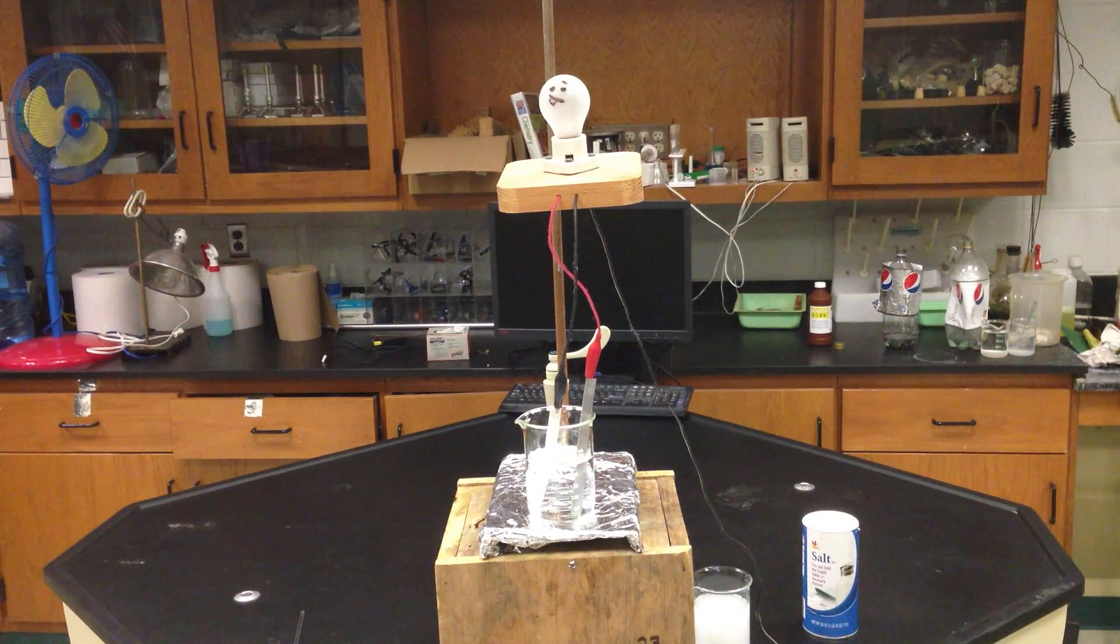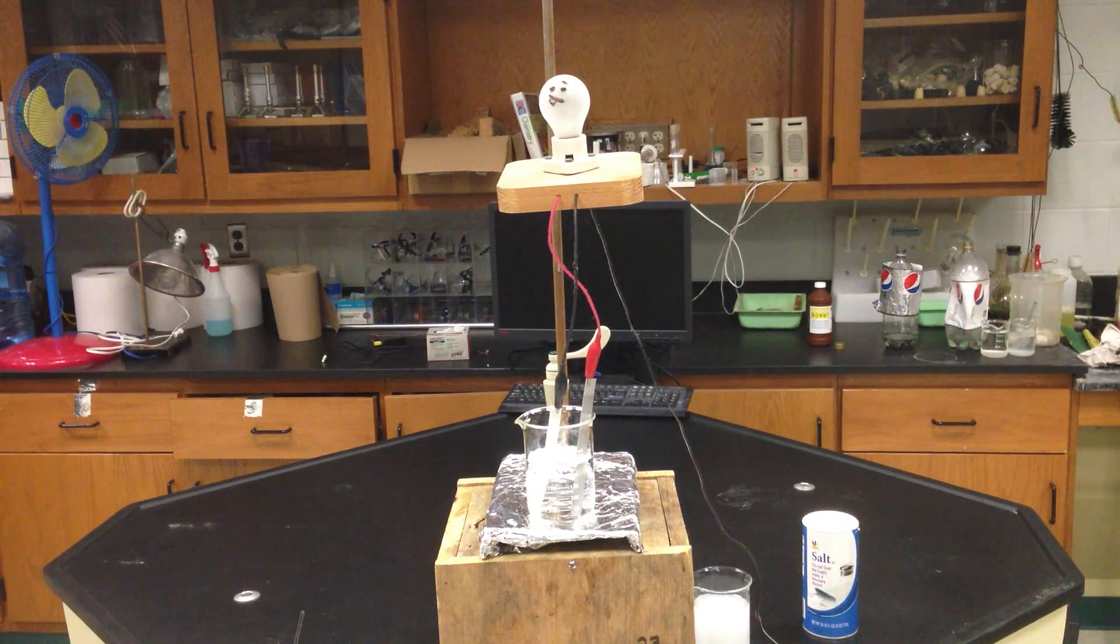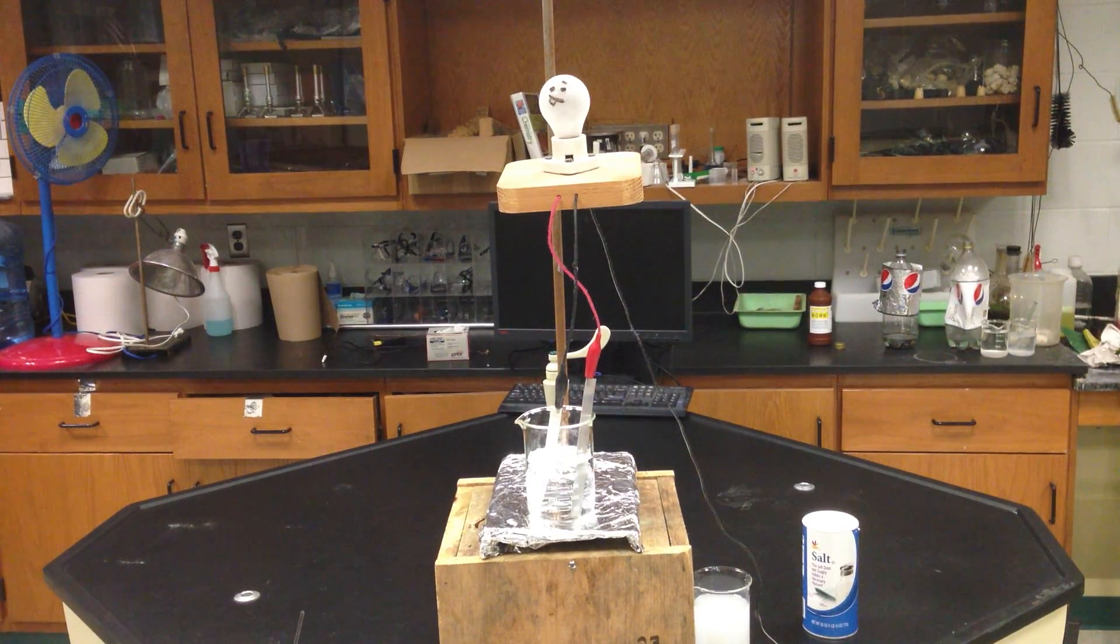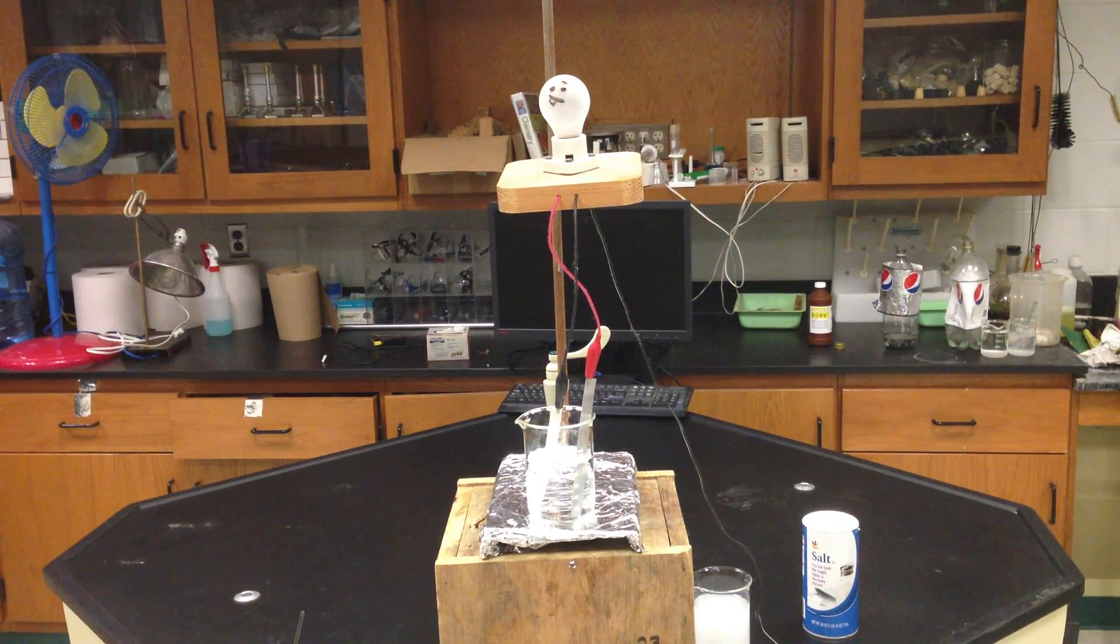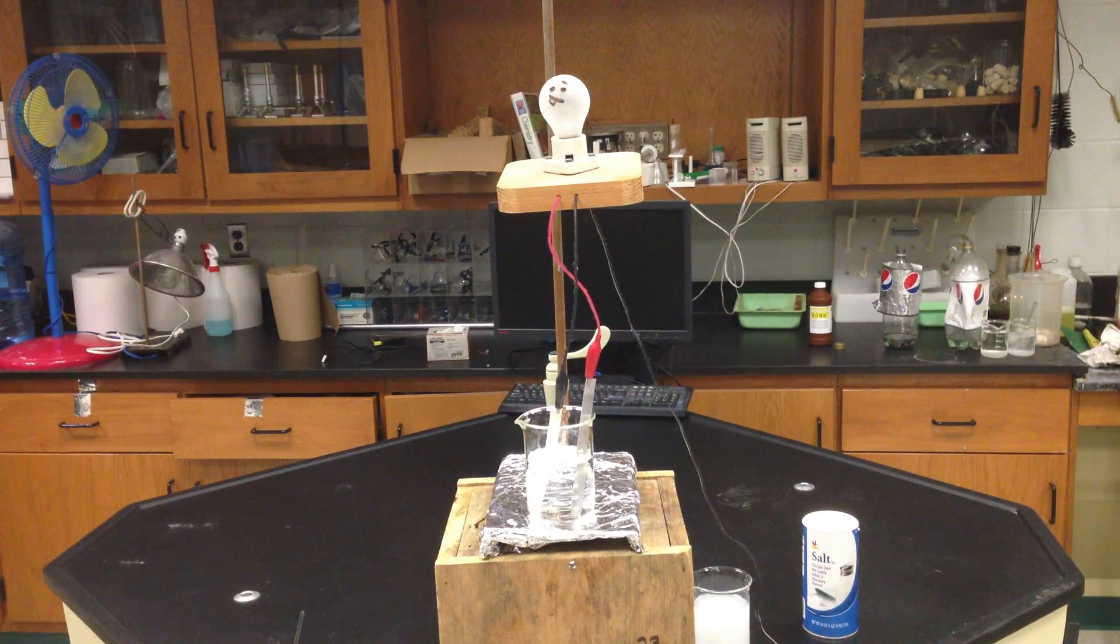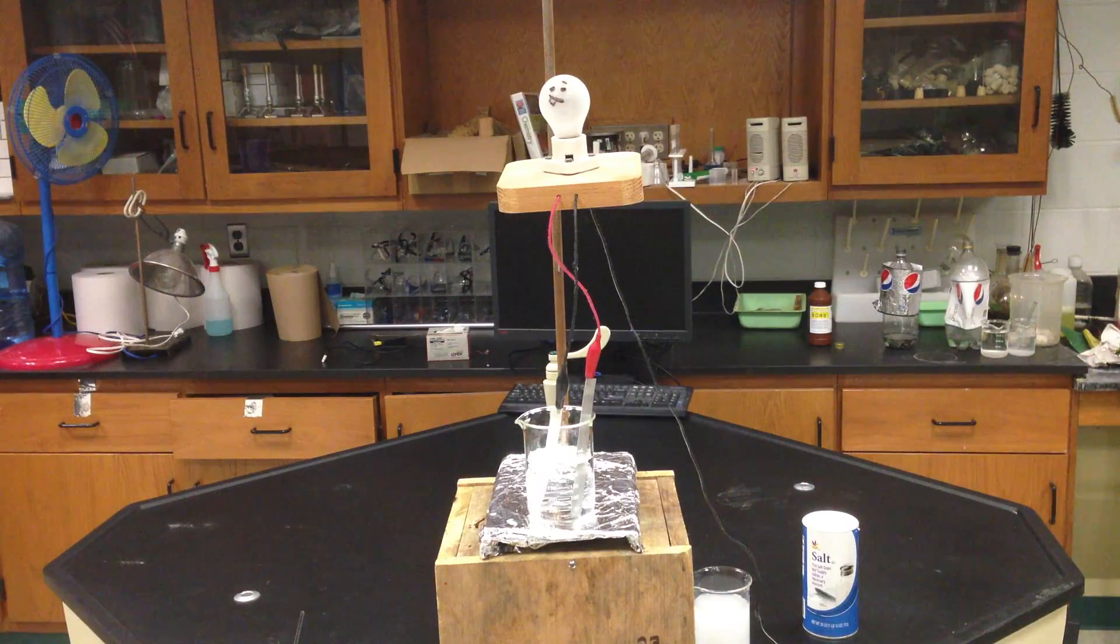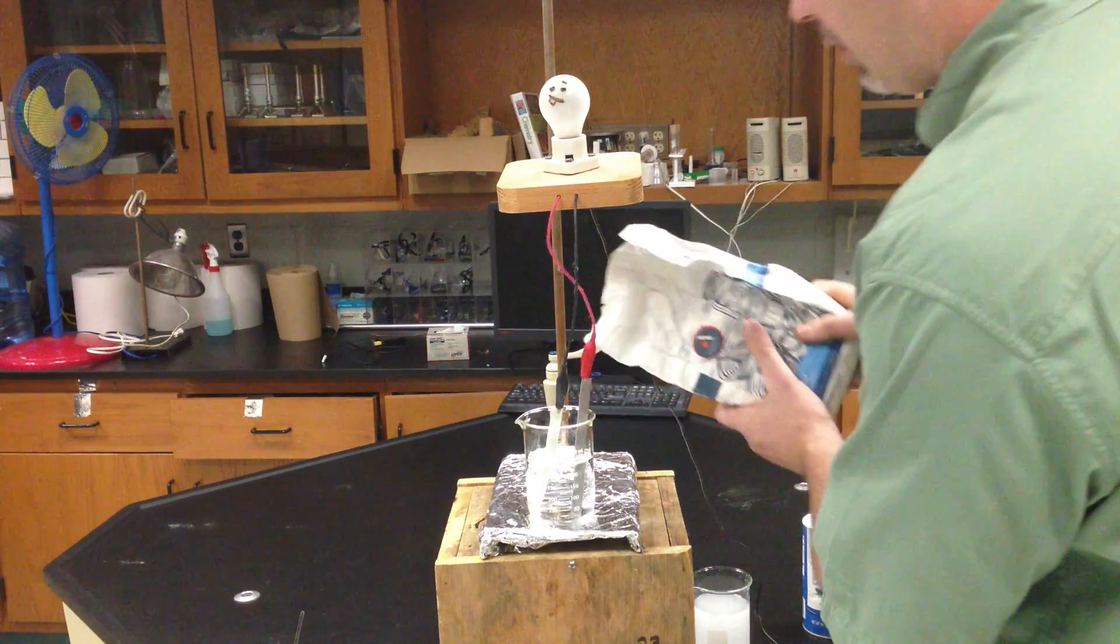Now, sugar is not ionic. It does not break apart into ions. So therefore, my sugar is not going to conduct electricity. So when I find my sugar, I'll be able to put some in that beaker. So here we go. Put some sugar in here.